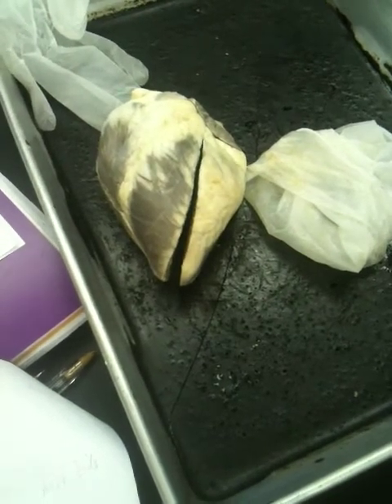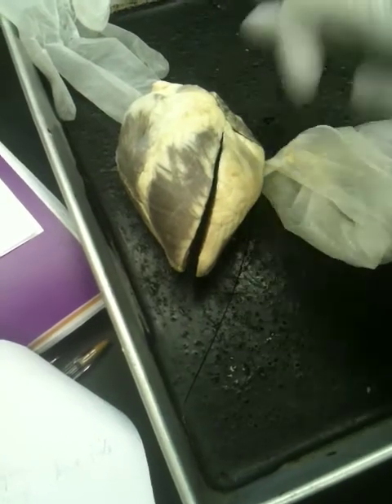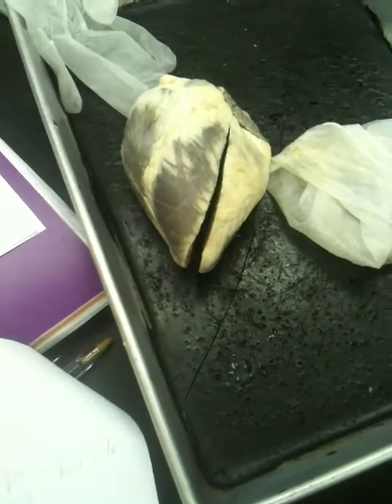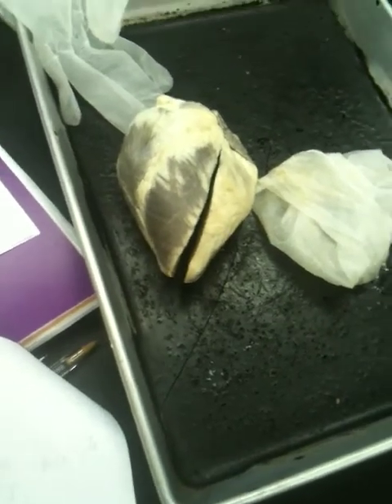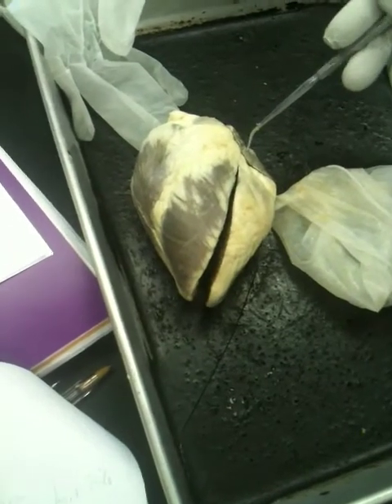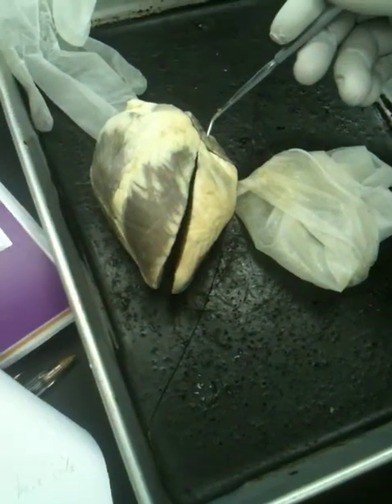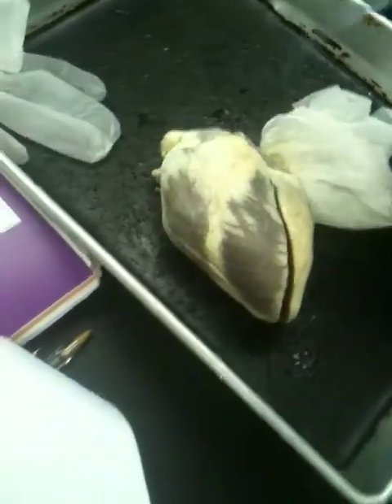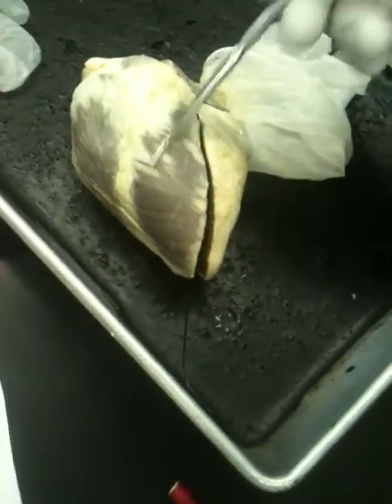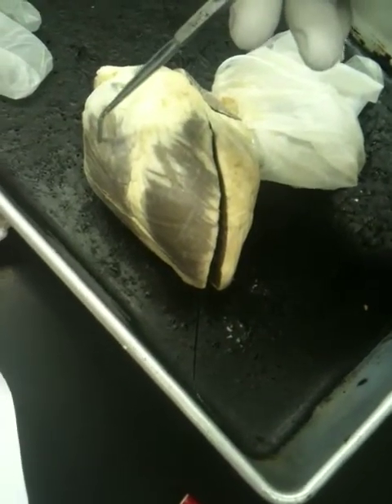Okay, and so we can't see the atrium from the inside, can we? No. You can if you cut farther up, but we haven't done that. Because all the spaces are ventricles. Unless I stick a pin right in there and say name the chamber. If we can't see the inside to see which side is thicker, we just know it because of the auricle on top. If I stick a pin right there, you can't see inside, but you know that the left ventricle covers the apex. So that means this one's got to be the right ventricle.